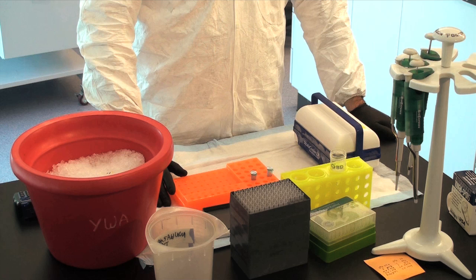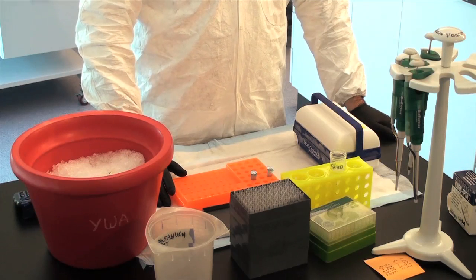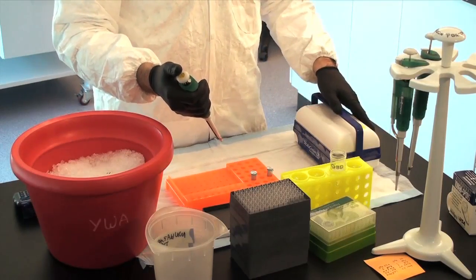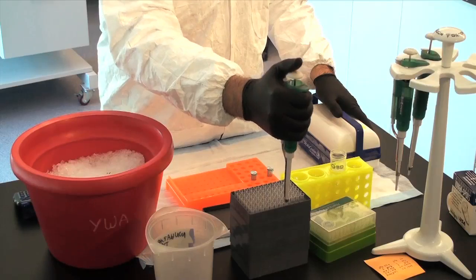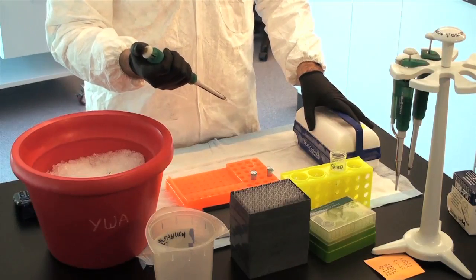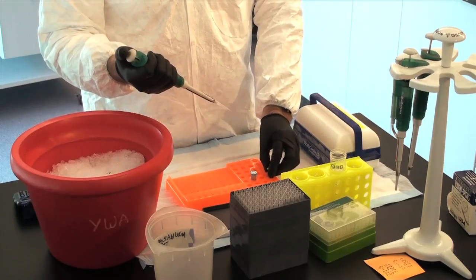Today we're going to perform a double digestion. Each restriction enzyme has a buffer to go with it. These are proprietary and are sent with the enzyme when they are ordered. The manufacturer of the enzyme can usually provide suggestions as to what buffer to use if you wish to perform a double digestion where the two enzymes are shipped with different buffers.